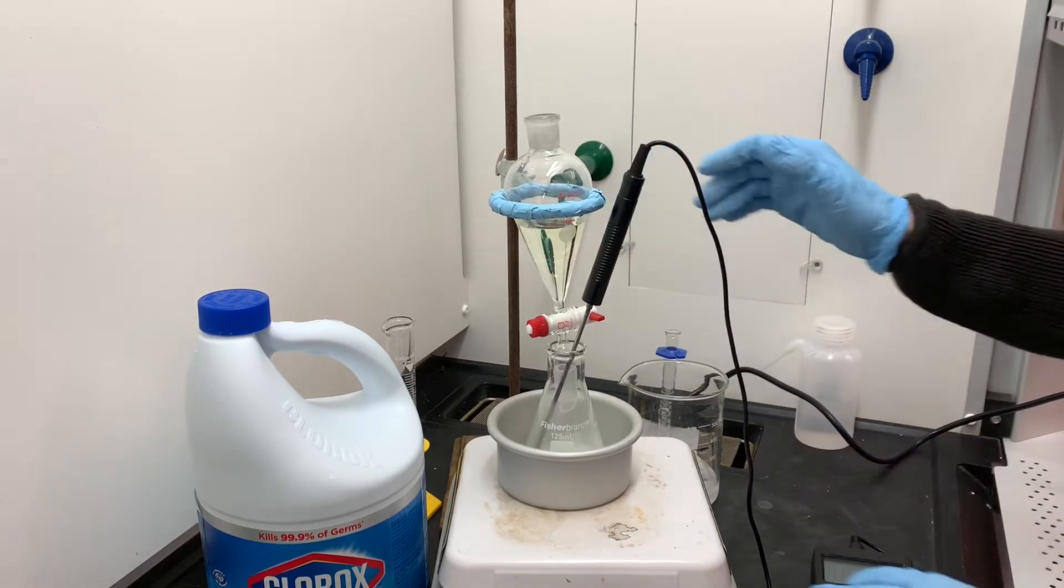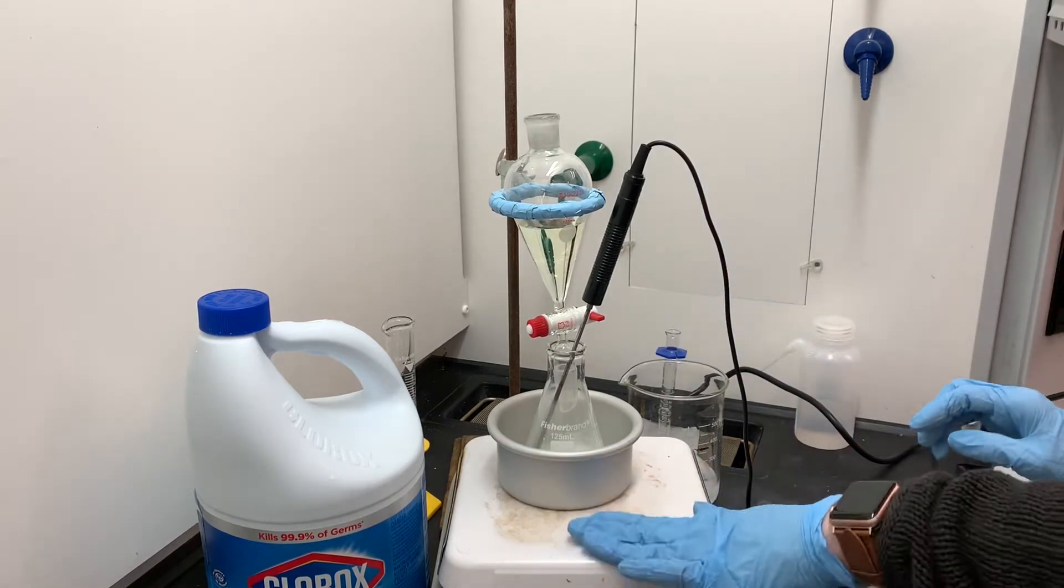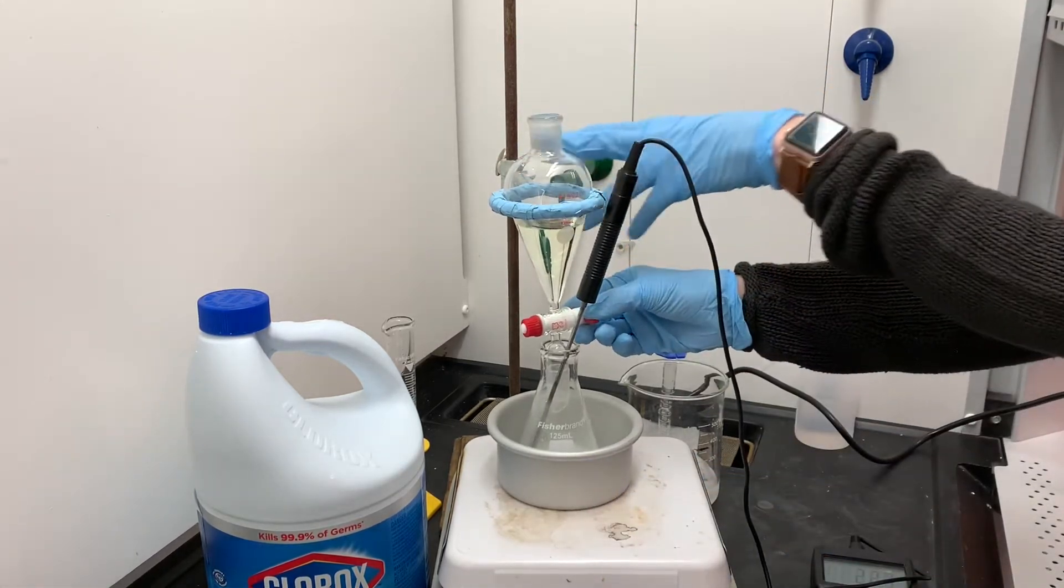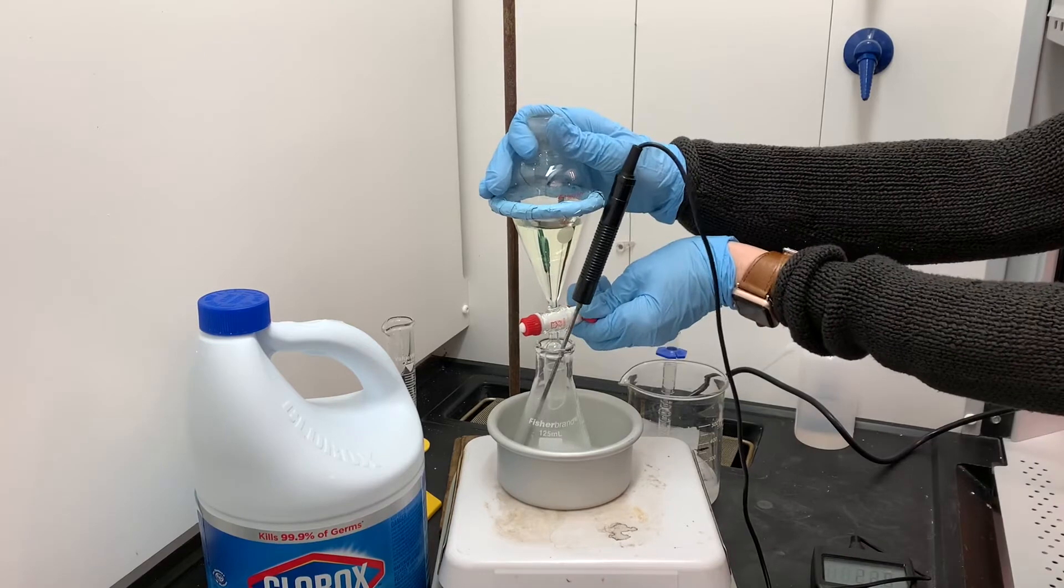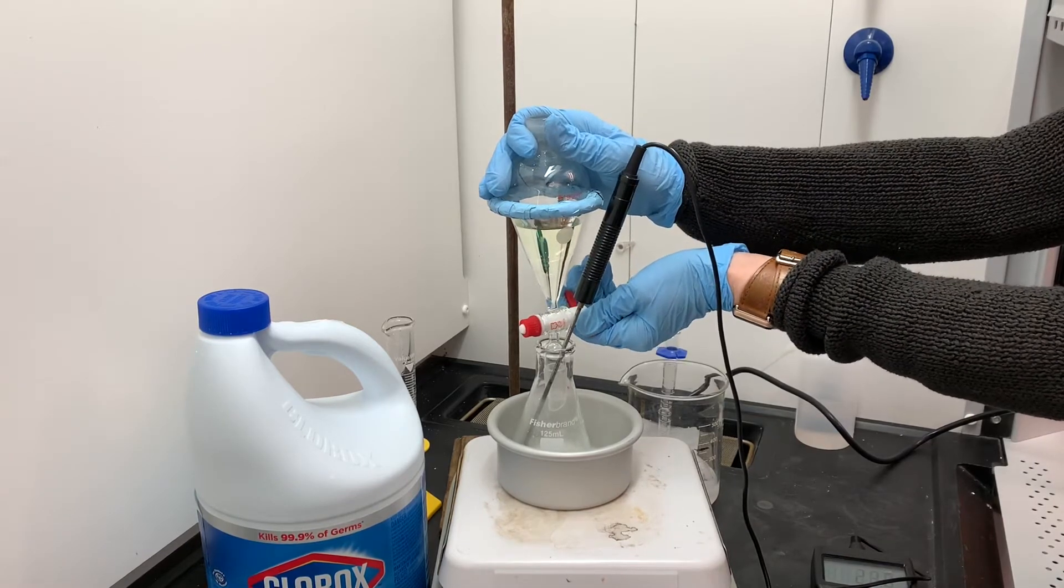We'll be monitoring the temperature the whole entire time and just kind of slowly adding small portions of the bleach into the solution.